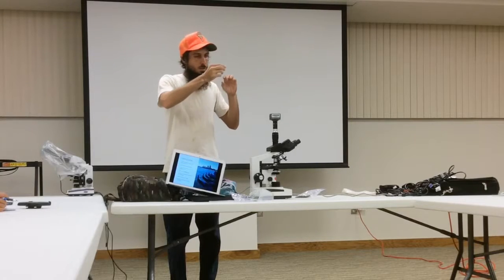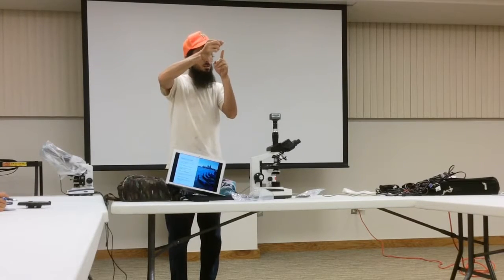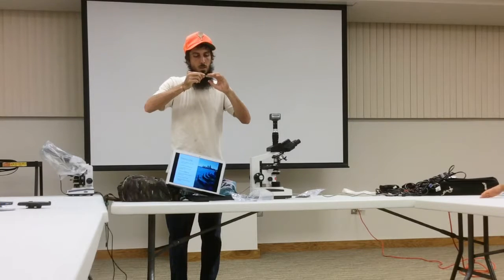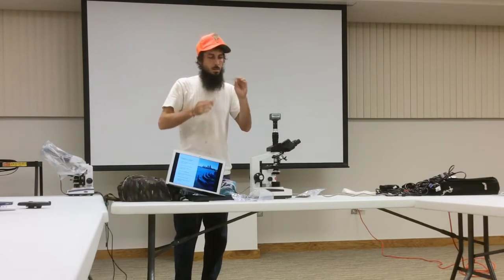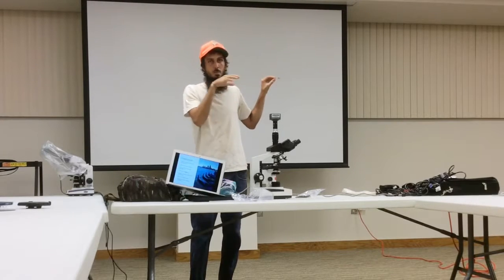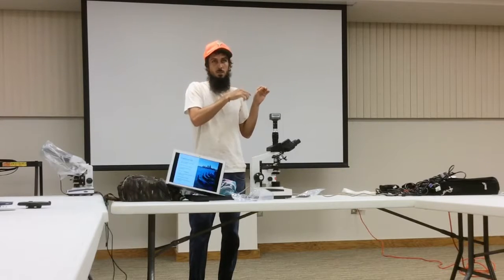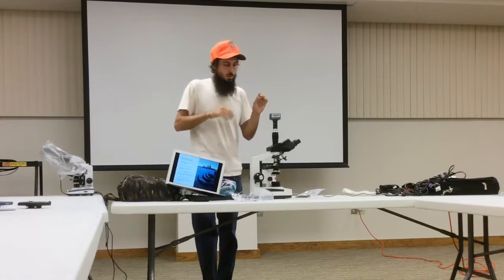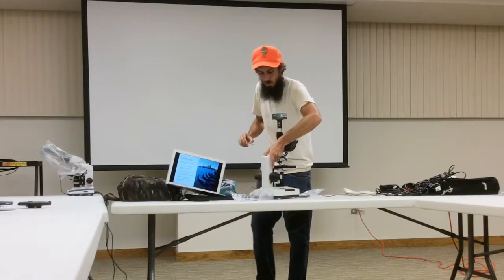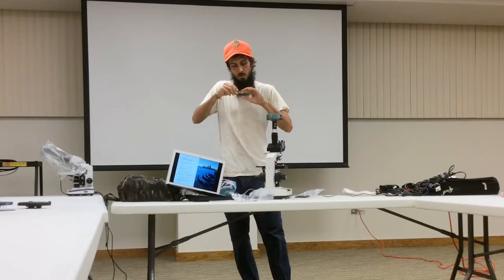And then I kind of, see how it's like all a cluster in the center? I kind of rub it around a little bit just to spread the water out. Try as best as possible to make it big. So you can see, I got almost over half the slide here. Probably be better, there's a clump of dirt in it though that's keeping it from totally going on there. Spread that out. Actually, I probably should spread it out better.